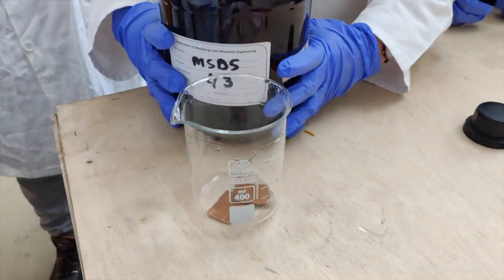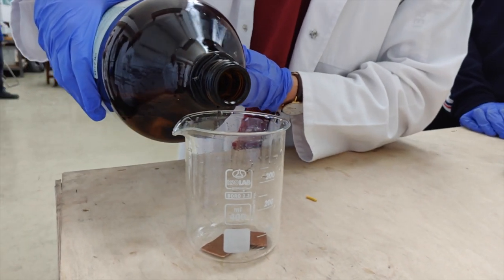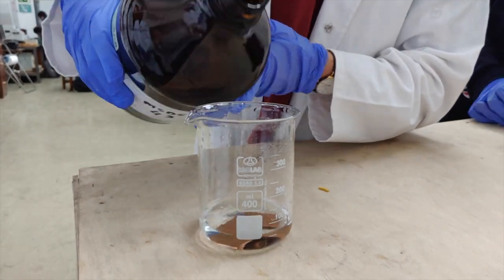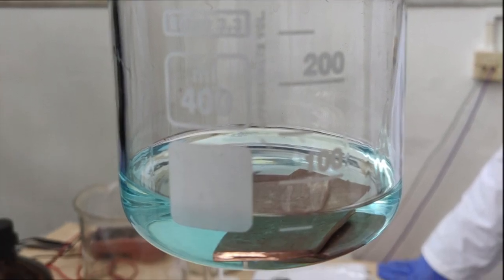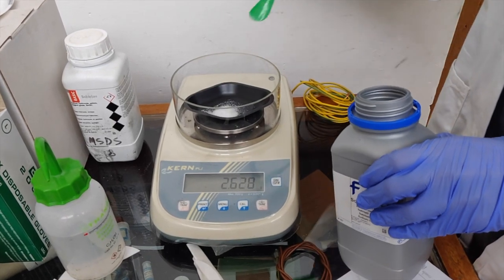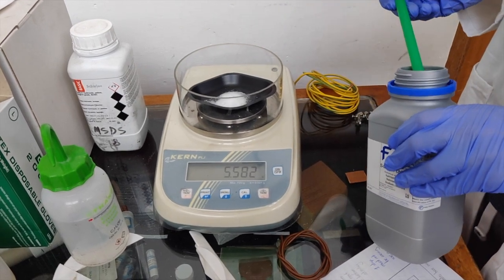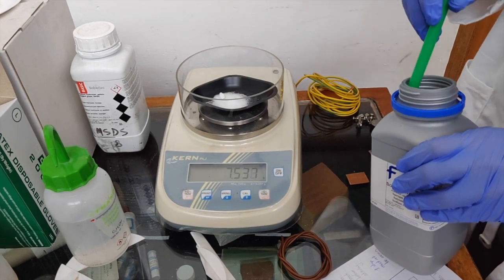Under normal conditions, the only type of energy absorbed or released during chemical redox reactions is typically thermal energy. However, when chemical reactions occur in the presence of two electric conductors, referred to as electrodes, separated by a conducting wire, an electric current is produced. To observe this phenomenon, an electrochemical cell can be set up. This typically consists of two half cells, with each half cell made up of an electrode immersed in an electrolyte.